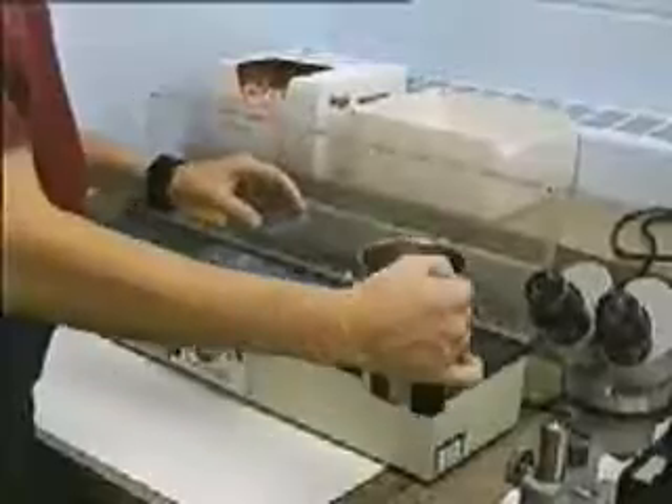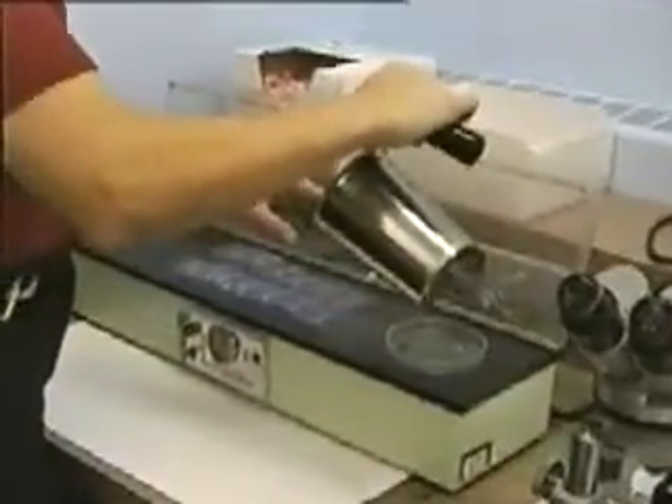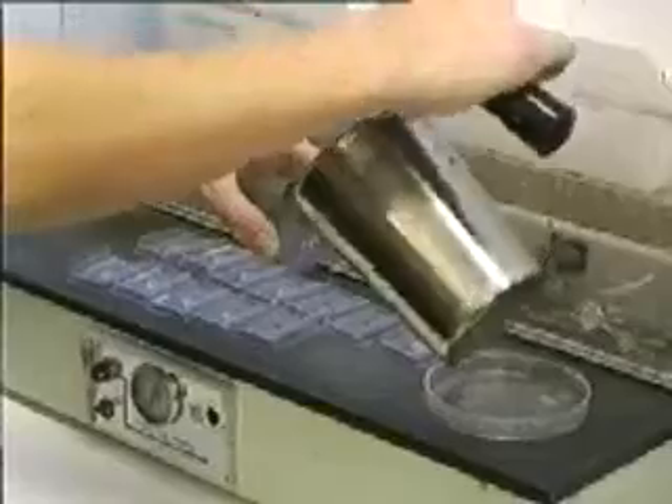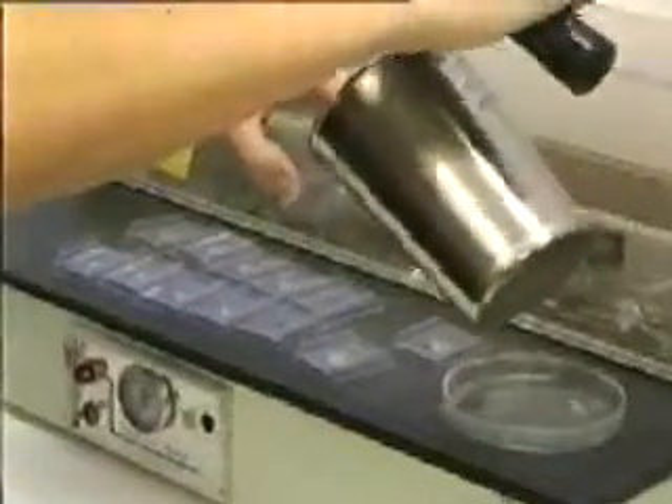Some fresh paraffin is dispensed into plastic molds and kept warm on an electrically heated table, and thus in a liquid state. The specimens may be removed from the oven and poured into an open petri plate where they remain in the molten state.